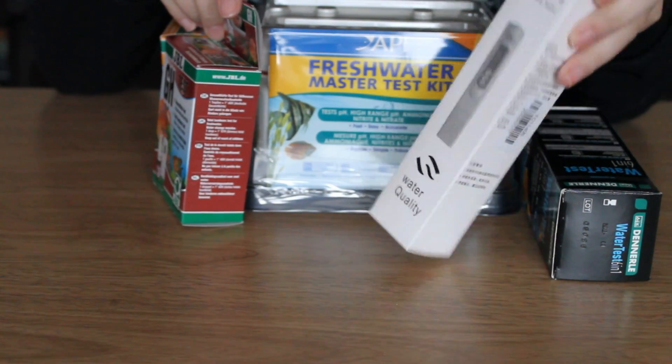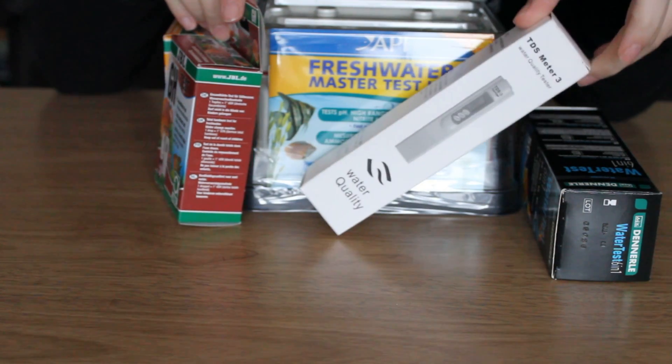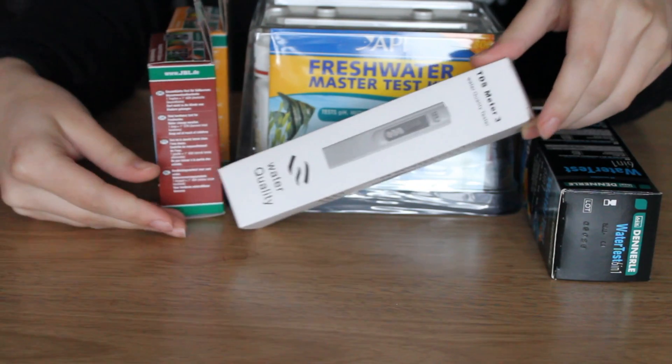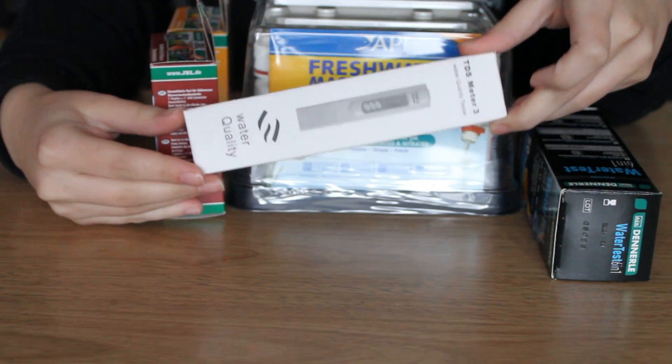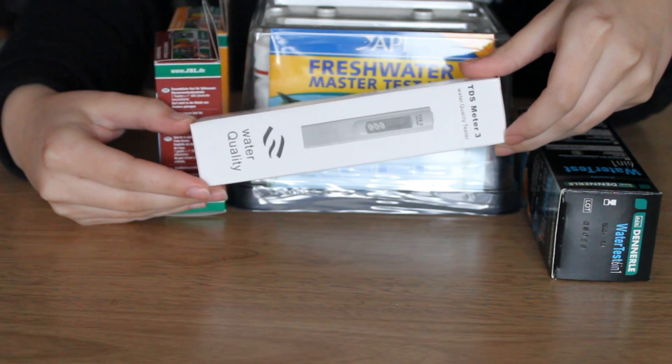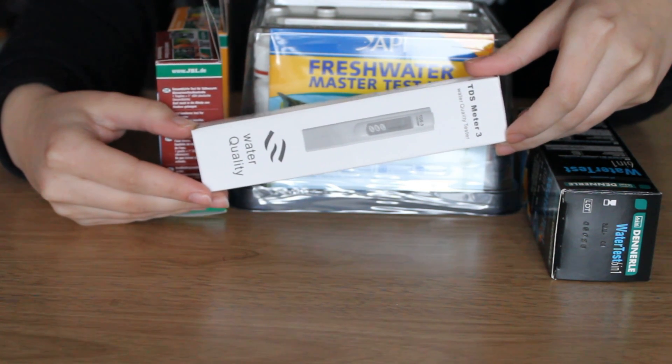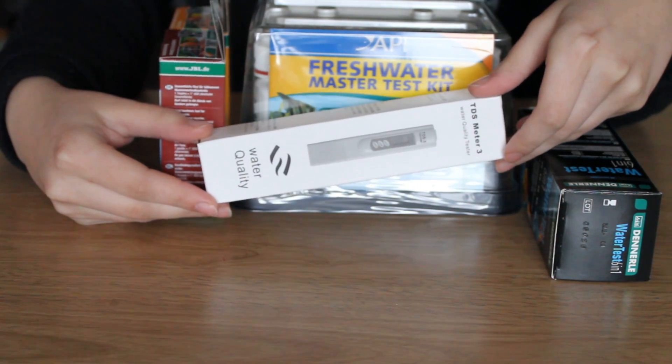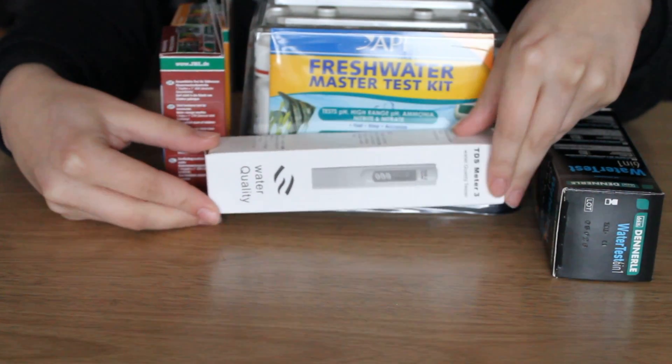We also have a TDS meter which is apparently very important when you're keeping shrimp. I've been trying to read up about the specific tests and what the results mean. I'm going to be honest with you guys, I don't totally understand it, so once I get the answers I may just show you and if you know what it means you can translate it for me.